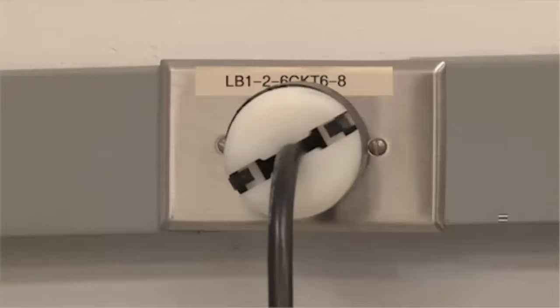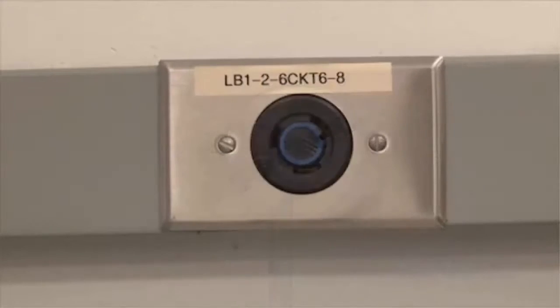For safety, unplug the instrument and roughing pump power cords from their respective power outlets.